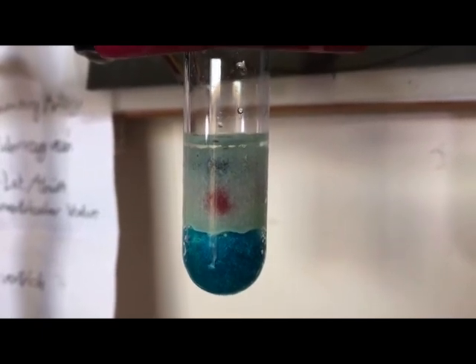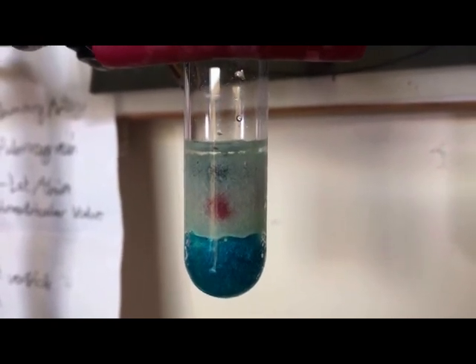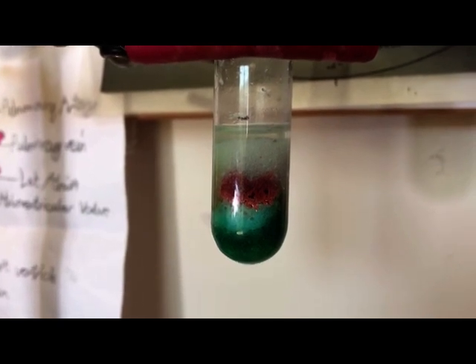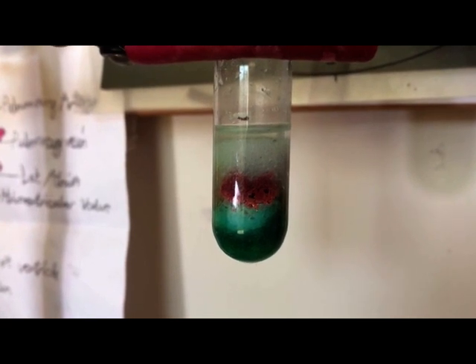After the first day, we can see that a reddish-brown substance has formed inside the salt layer. Two days later, you can see a thicker layer of this reddish-brown substance in between the two layers. Its reddish color and shiny appearance tells us that this is metal copper.